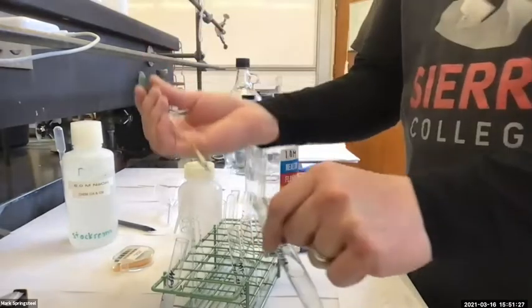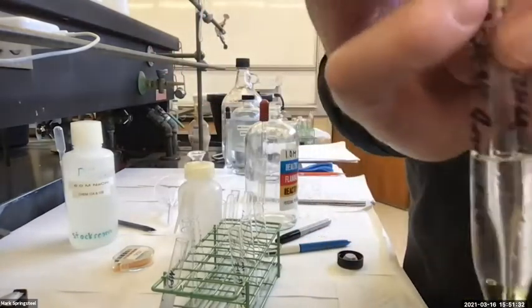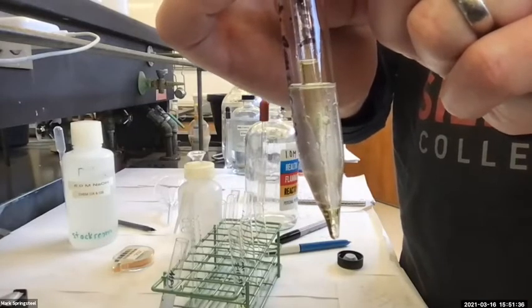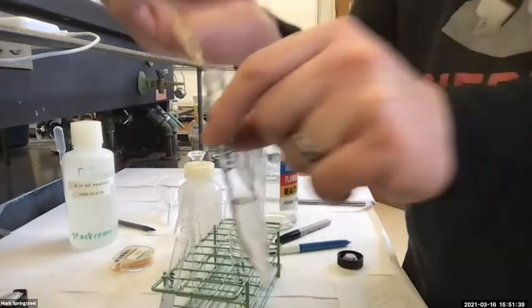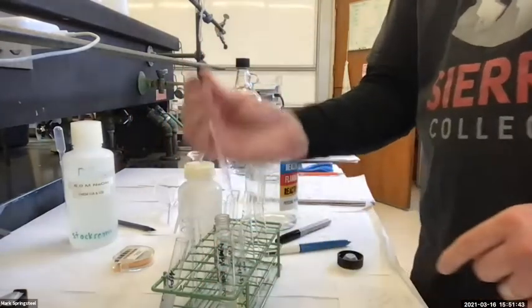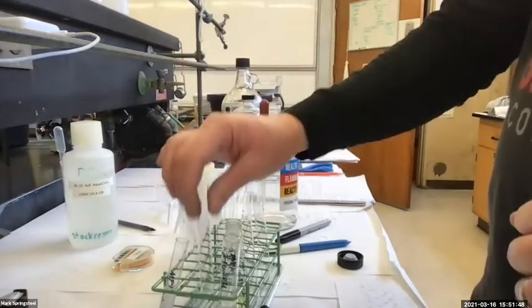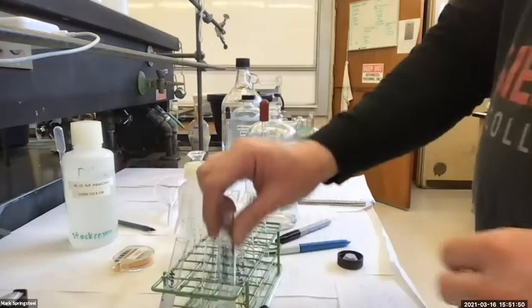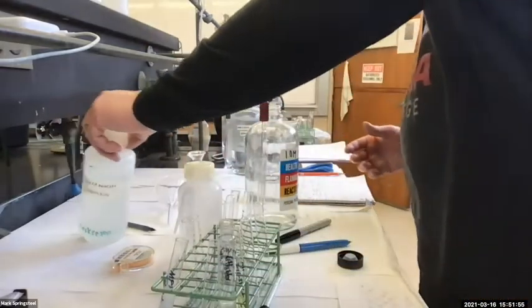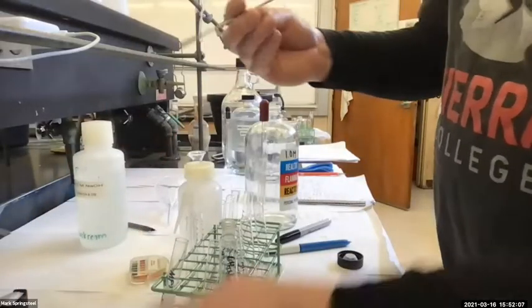See how it's getting narrow at the bottom? Okay, I think I did a decent job of separating those two. And then my aqueous layer, I'm going to put it in another test tube. Well, you know what? I'm just going to go ahead and make it acidic here. Or not acidic, basic. So it should be acidic. Let's just check. It currently should definitely be acidic.